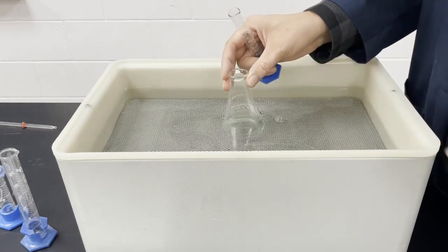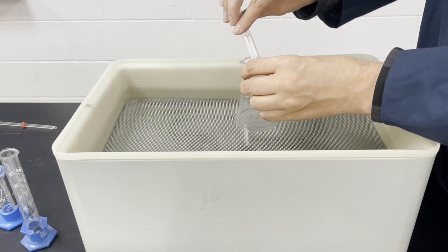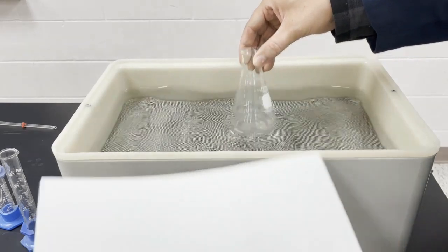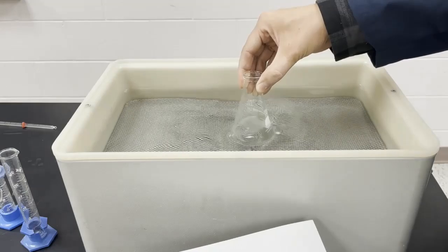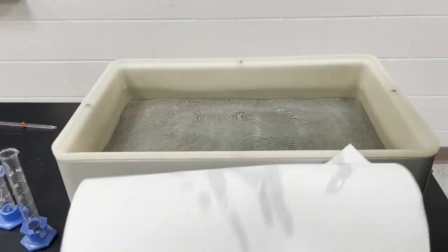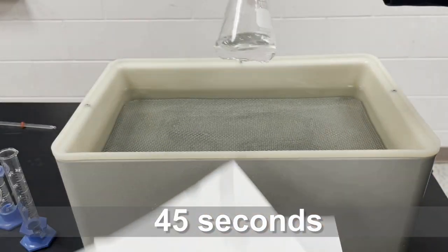All right, one thing with the hot water bath, you're always going to hold on to it, because if you let go, it can easily tip over. So let's start. I'm going to shake it. So you can see that pink color. All right, I think we're good.